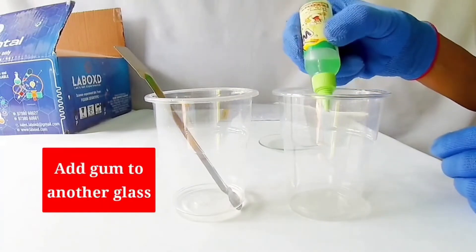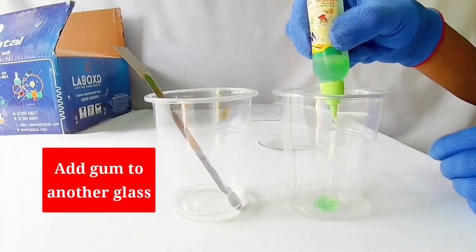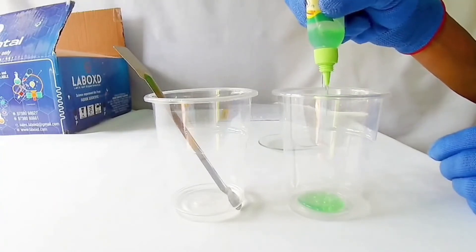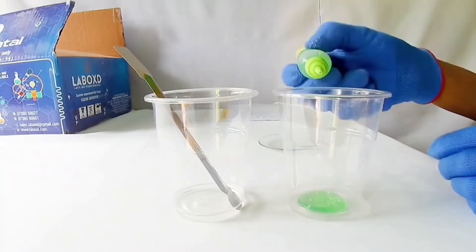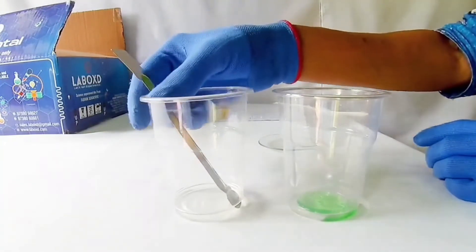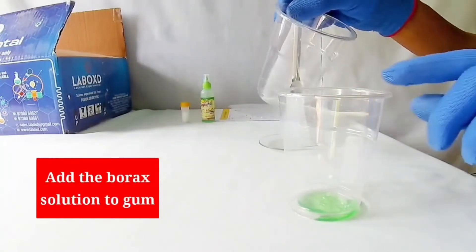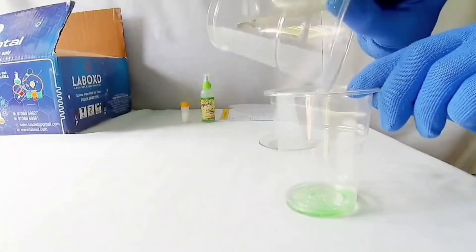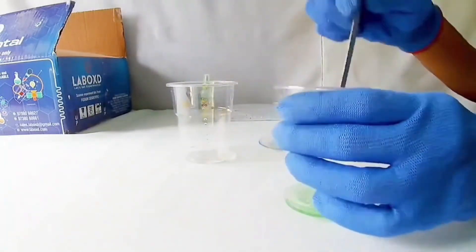Add a little glue to another glass. Add the borax solution to the glue. Mix it well.